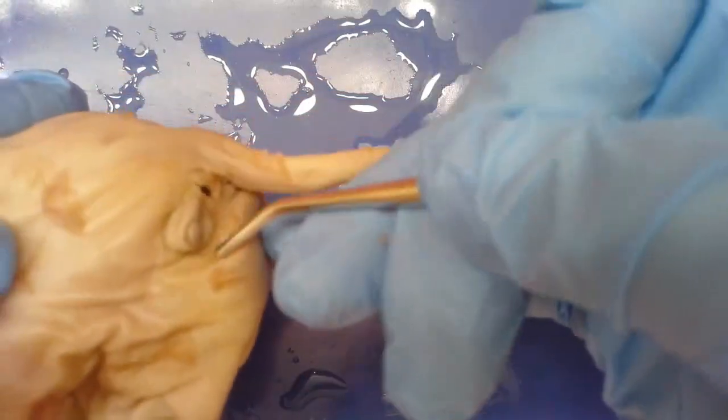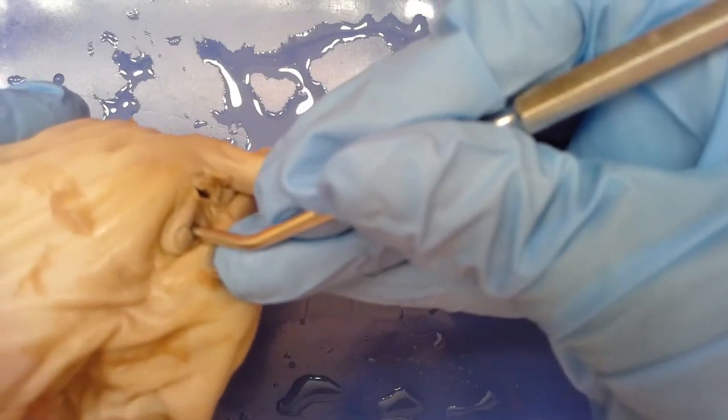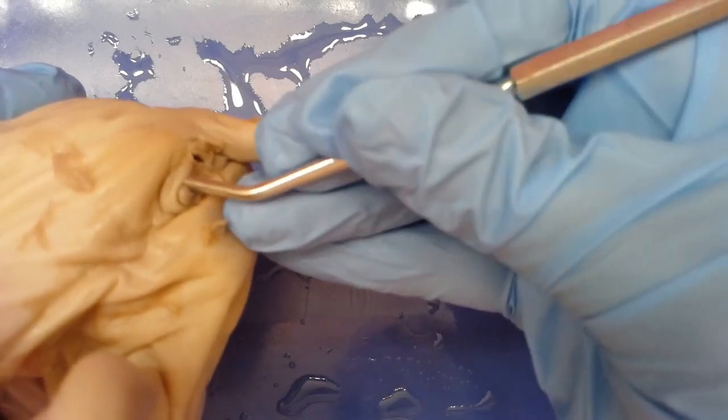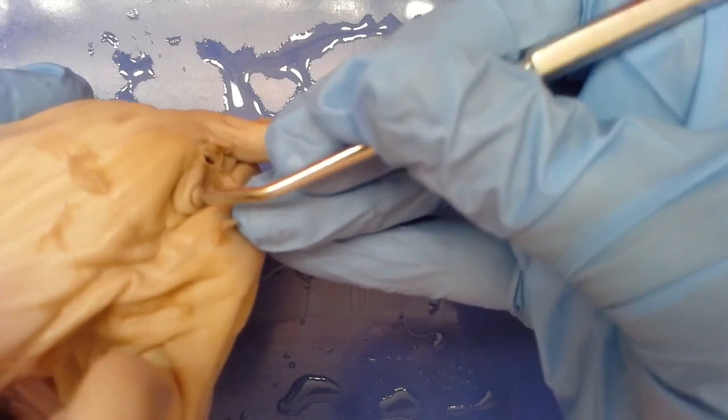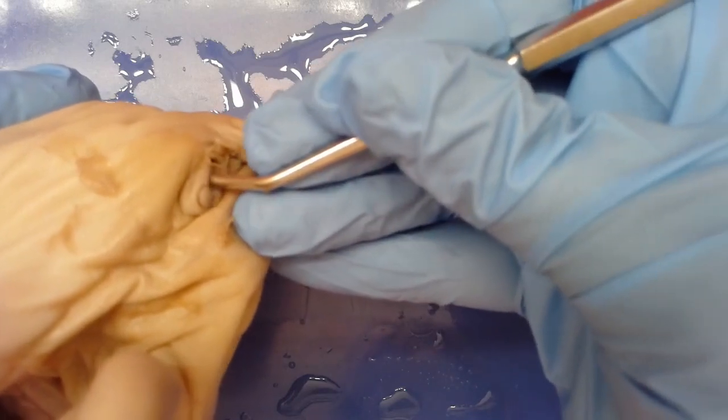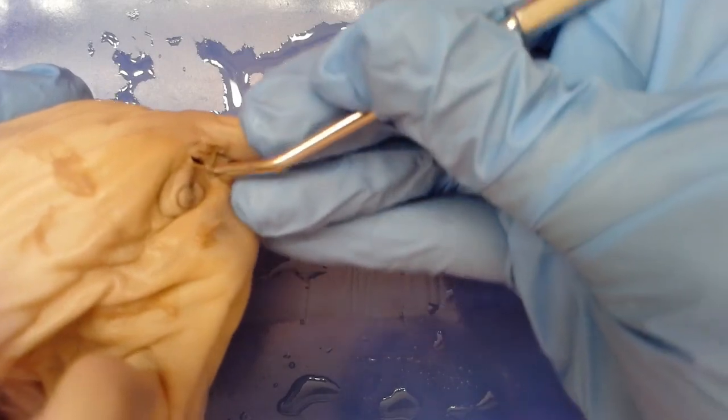Moving further back towards the rear of the pig — if I lift up the tail, there is an opening there. That opening is the anus, the exit for waste products at the end of the digestive tract. You also notice another structure just underneath that — this is the urogenital papillae, and this is actually an opening that leads into the birth canal or vagina. That opening is called the urogenital opening, and the little projecting part is the urogenital papillae. This is what gives us the indication that this is a female. Just dorsal to the urogenital opening is the anus, which is the exit for solid waste from the digestive tract.